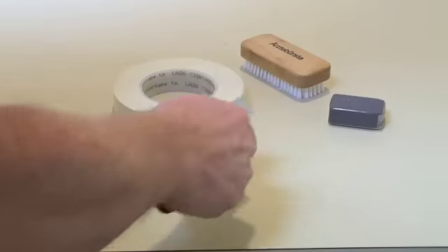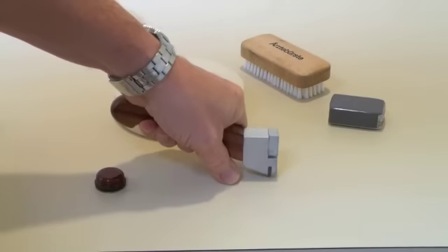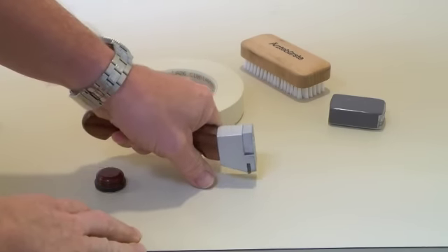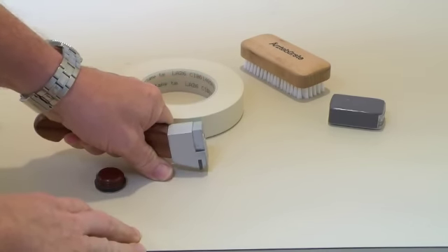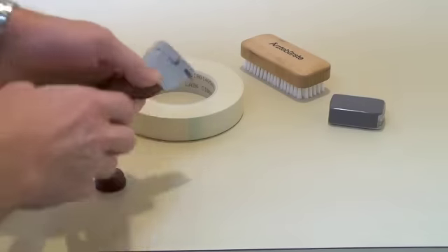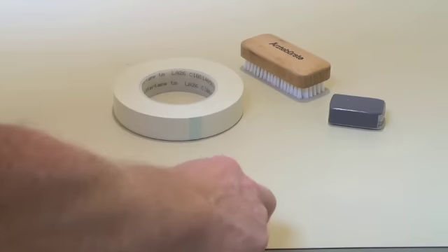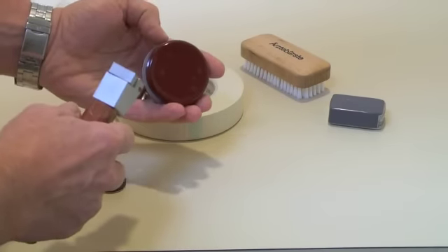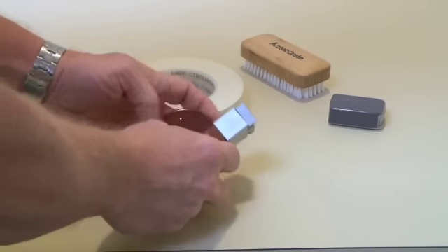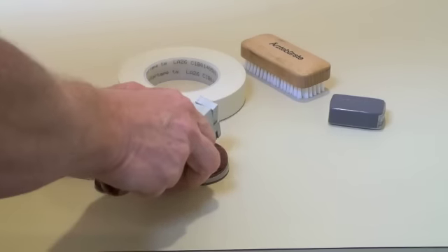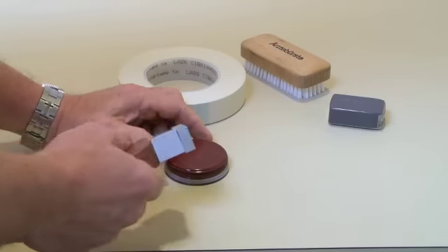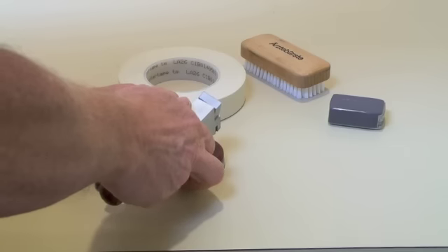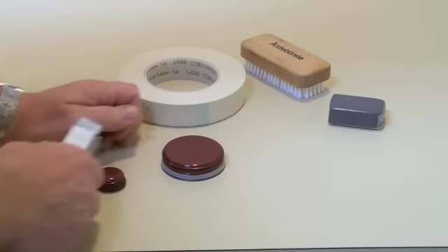The normal way of using a crosscut tester is to press it on the surface that we want to cut and draw it. Press heavily down to make sure we cut through the coating and pull it in two directions, 90 degrees apart. If we do that on this small drum plug, you can see it would be very difficult to hold the plug and force a good cut without the danger of cutting your fingers or slipping off and getting a poor cut.